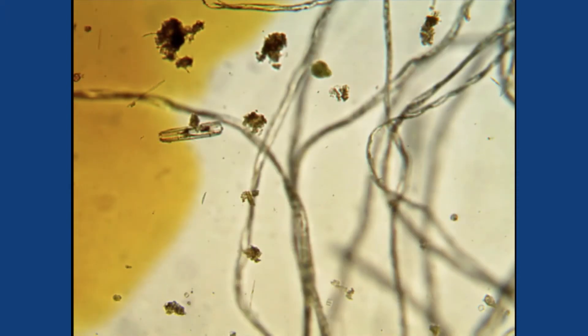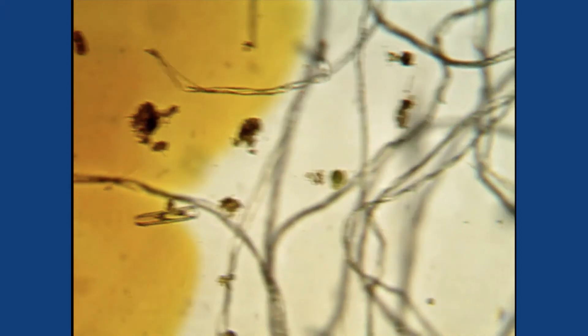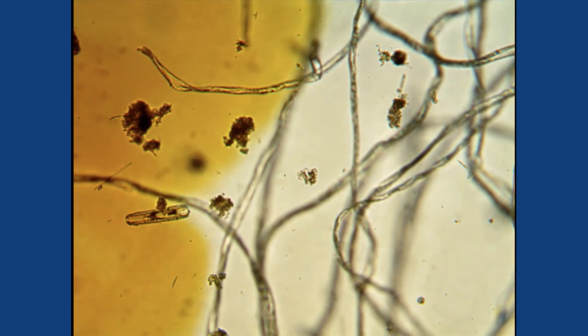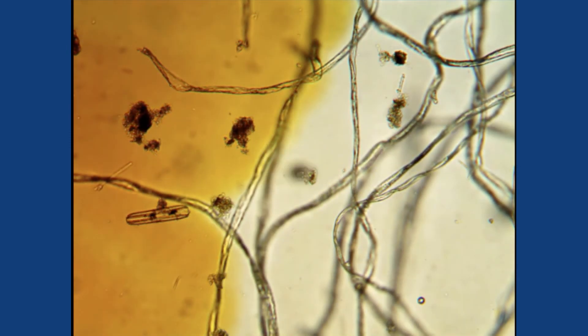The iodine will slowly move underneath the coverslip, mix with the water and kill most living things. Verify that you see the iodine mixing in with the water.